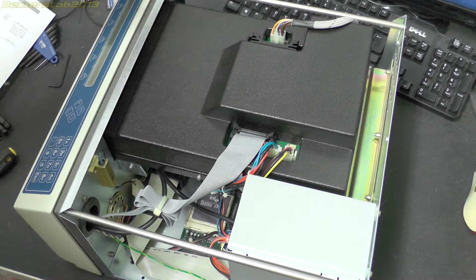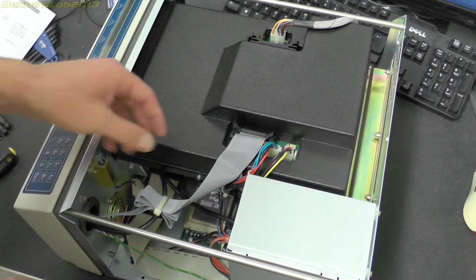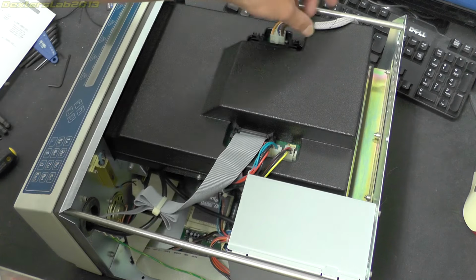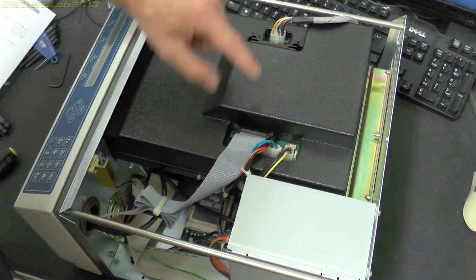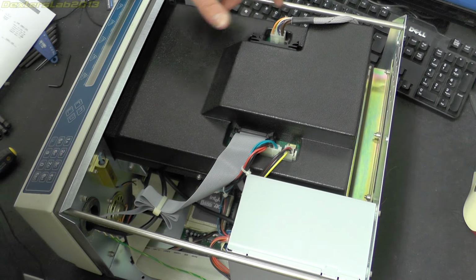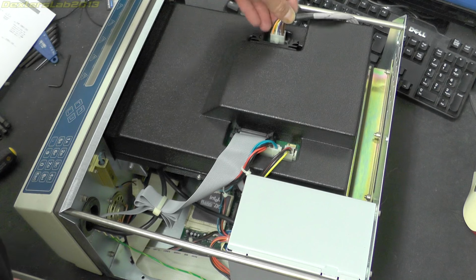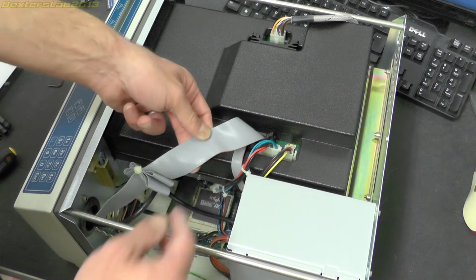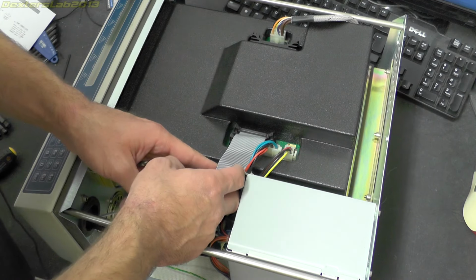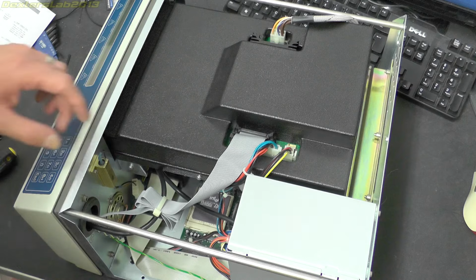Looking up at the top here, we have this plastic cover, which is obviously the sort of science area where everything actually happens. I've got a number of ribbon cables and what look like power cables running to it. That one I can just see through onto the PCB below, and it says lamp and filter motor. So the motor drives are on this PCB, and they're sent down to the lamp and the filter motor. And then we've got this cable coming up here, which is labelled LCD keypad interface. So that connects to the LCD display and the keypad.